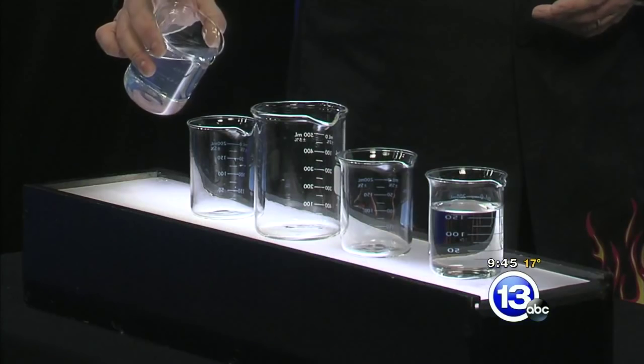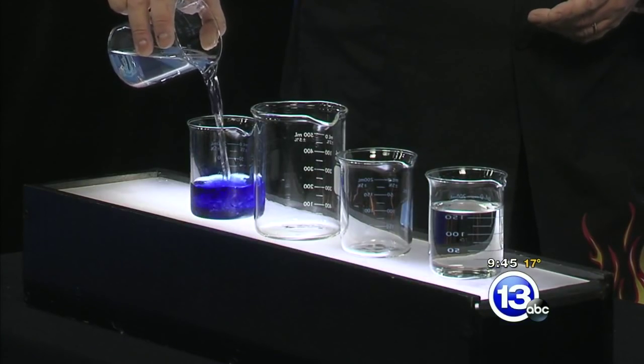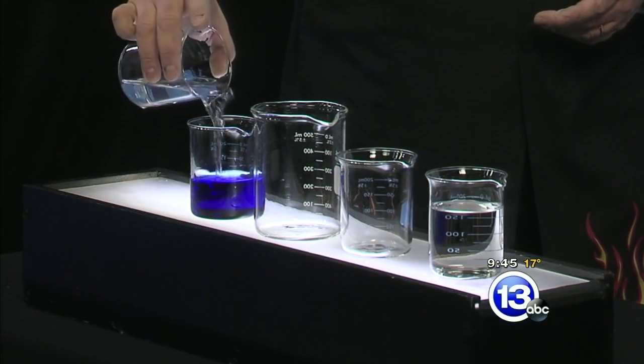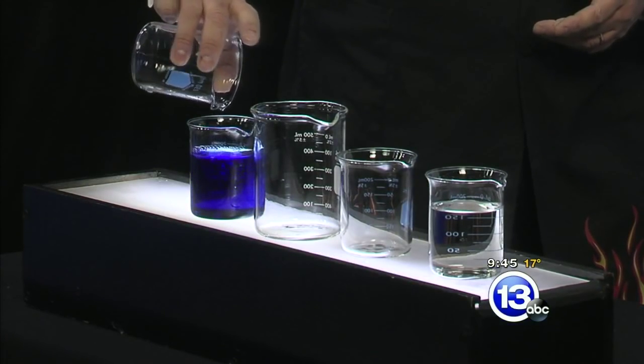In this beaker, I've added an acid-base indicator, thymolphthalein, that when poured into this container which has a little bit of sodium hydroxide at the bottom — watch what happens. Pour it in and we go from clear to that beautiful blue color. It's like a magic trick!